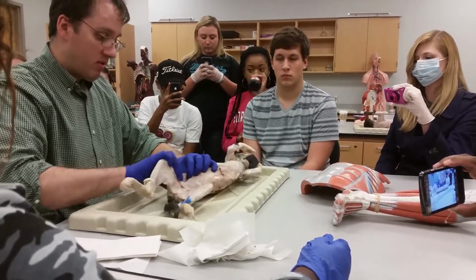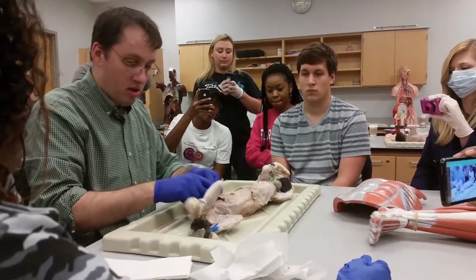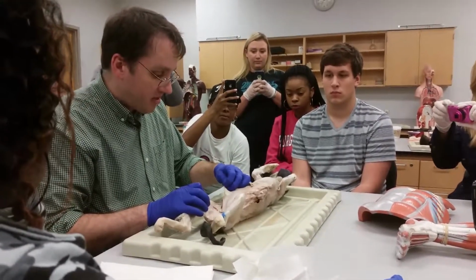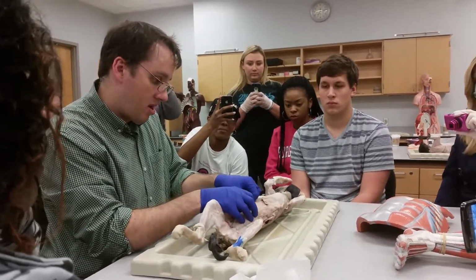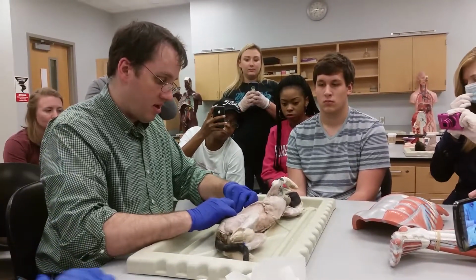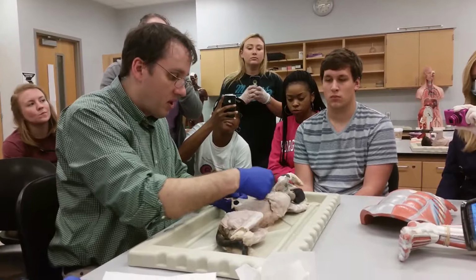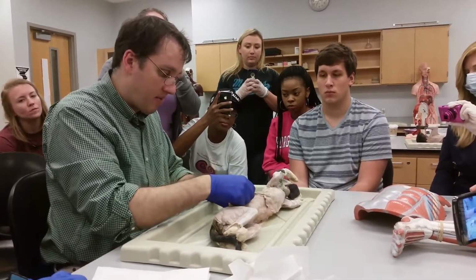There's also, of course, going to be layers of fascia on here. So we'll get some of this fascia off so we can see the muscles more clearly. All right, so pull this fascia off. Notice the segmental nature of the blood vessels there. See that? The arrangement of the body in this region is very segmental. It's almost like a caterpillar.